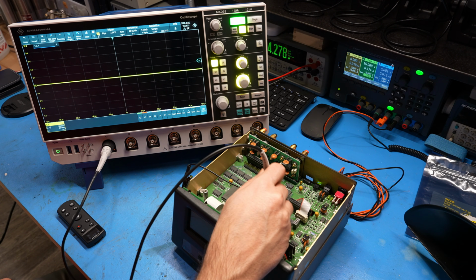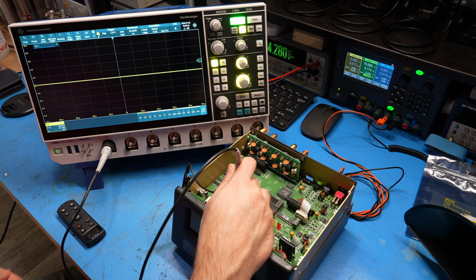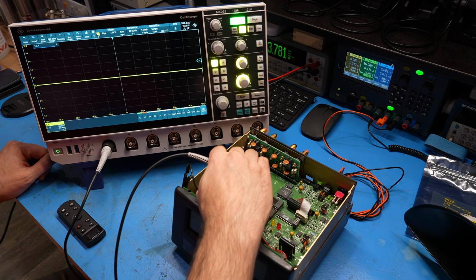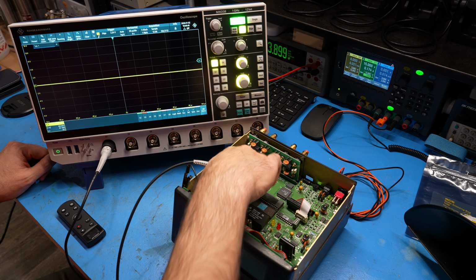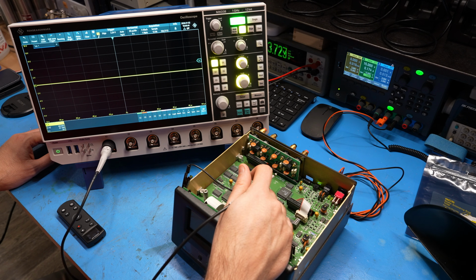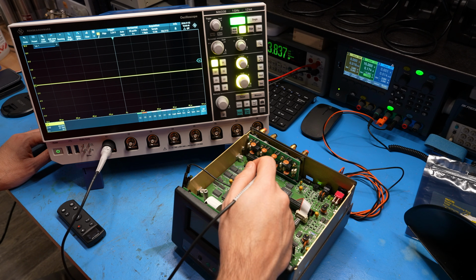So even though the microprocessor has clock, it's not doing anything at all. So I'm beginning to think that perhaps there might be some damage. Now, it is not hot at all, but it is possible that something's happened to it. And you may ask, well, what about the EEPROM? I guess it could be that too, but these are pretty inexpensive. Let's take it one step at a time.